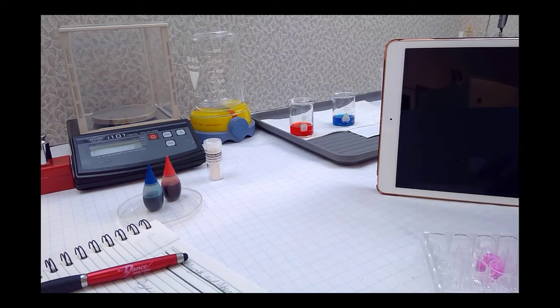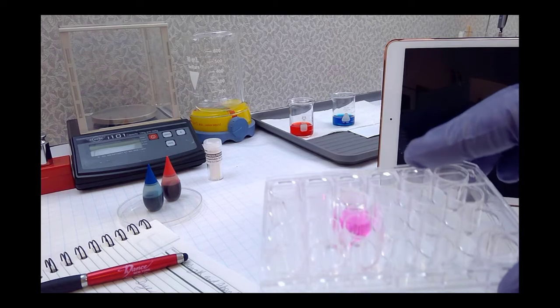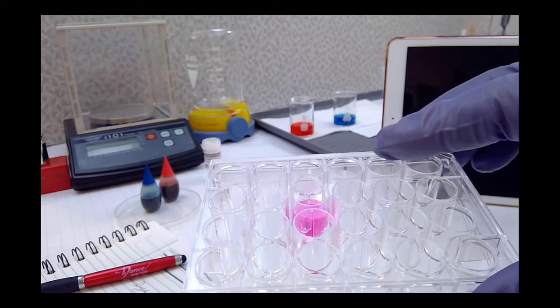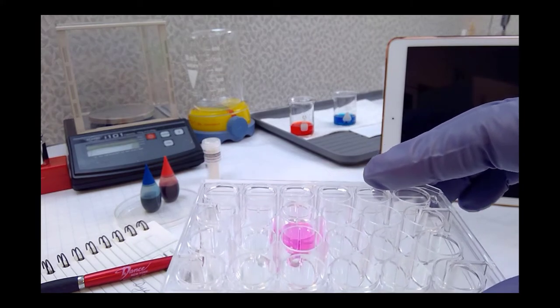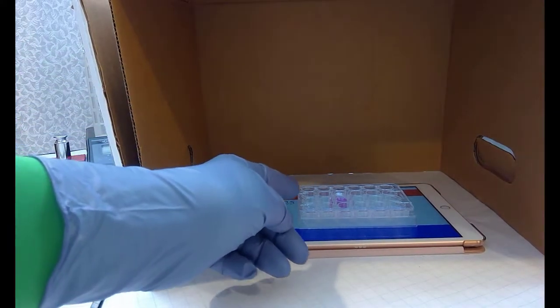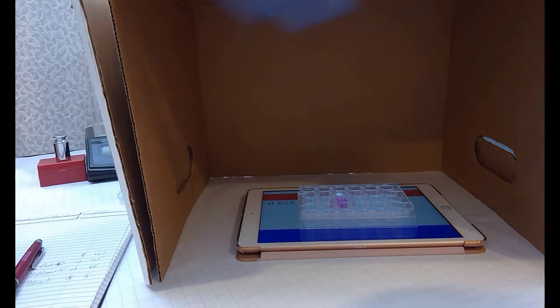Okay, now we've got our pink, or I think magenta is probably closer to it, in that well. You can pretty well see it here. I'll hold it up to the camera lens, and there's that pink. And now we're going to go to our special spectrophotometer to analyze this magenta. Well, here I've got my reaction plate that I've put into this box that I have. That's going to be my dark room. I just took a banker's box, cut off one segment, and cut a hole at the very, very top.